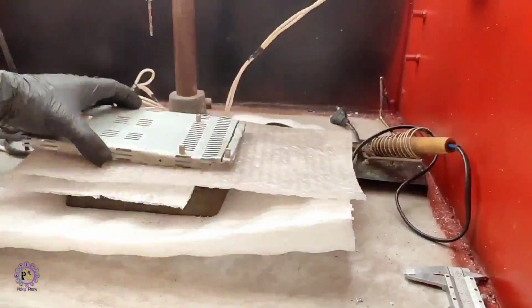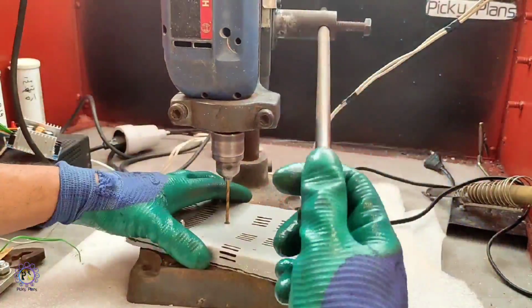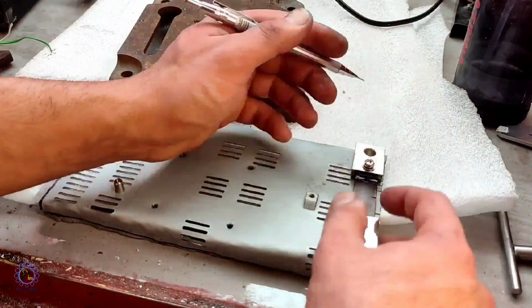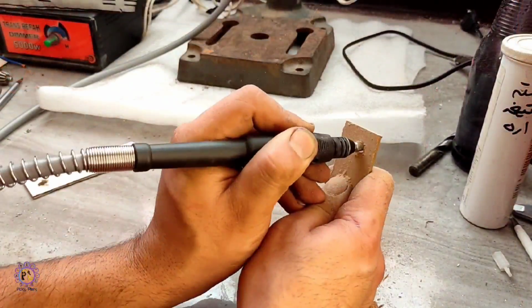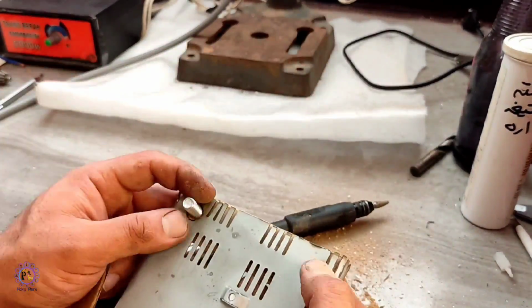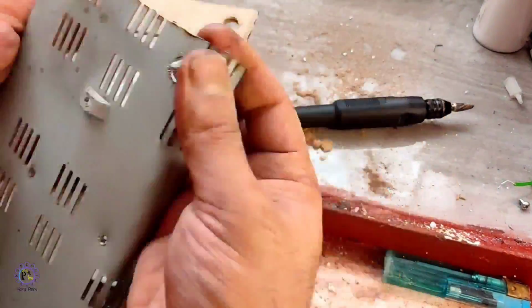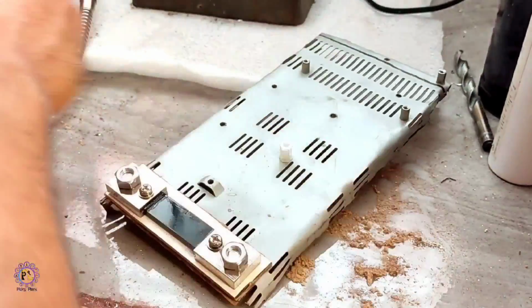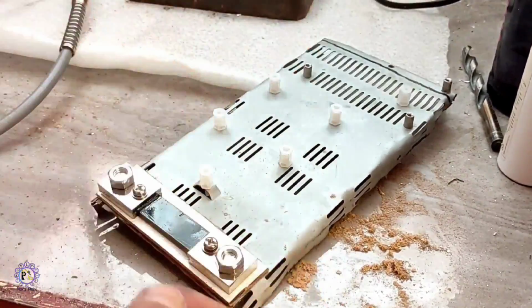After finishing the casing, we needed a stand to mount the whole circuit on, so I decided to make a metallic stand. Then I made a suitable place for the shunt resistor. The shunt resistor was placed on the stand, and next I added a spacer to tighten the whole circuit on the stand.